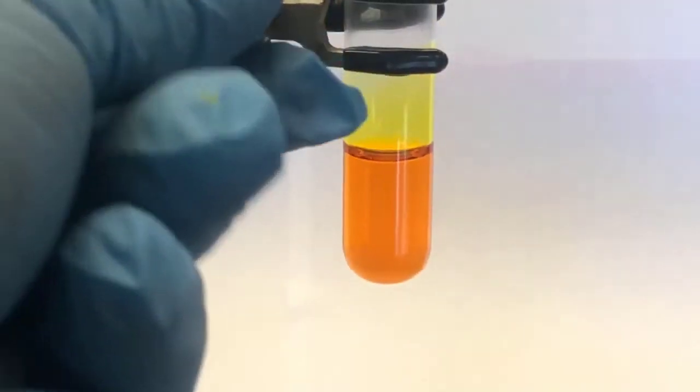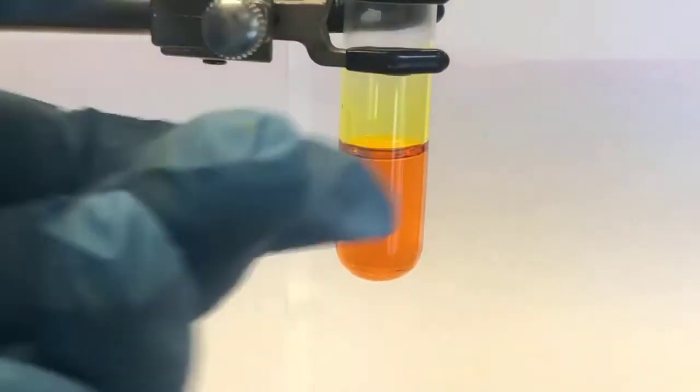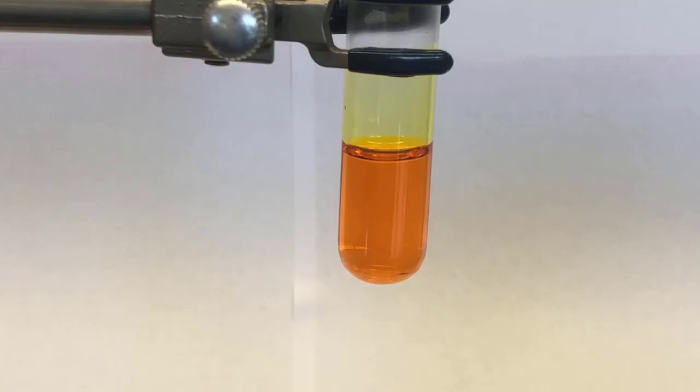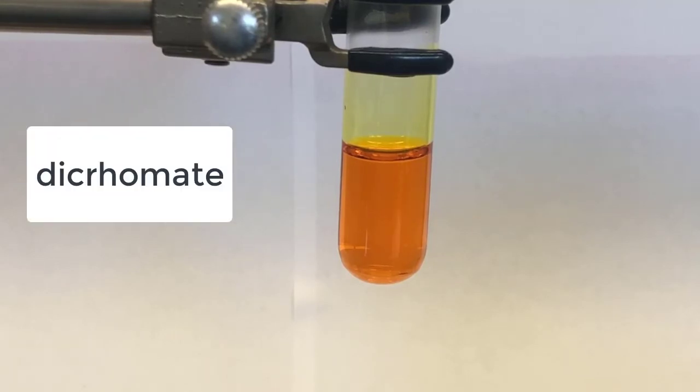Now, when you write your observations in your notebook, telling me what color it looks like doesn't help. What you need to say is what it looked like before you added whatever you added, in this case hydrochloric acid, and then you need to talk about what it looked like after. So the description of the chemical reaction is describing the change, not just what something looks like.